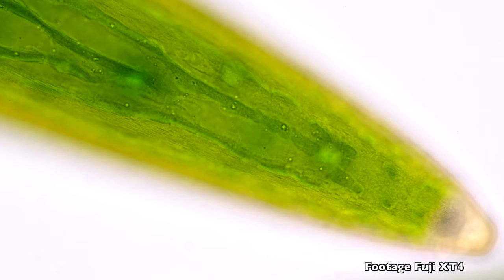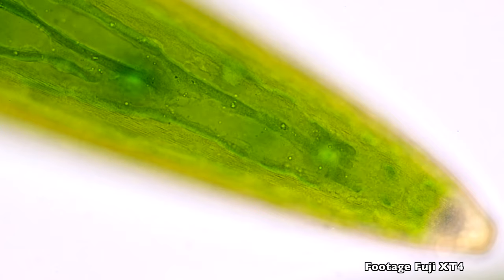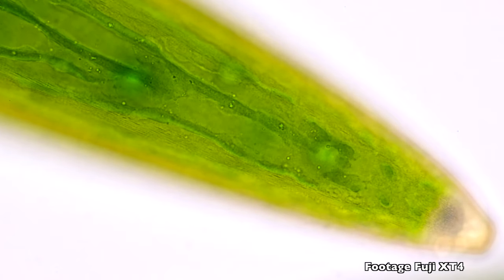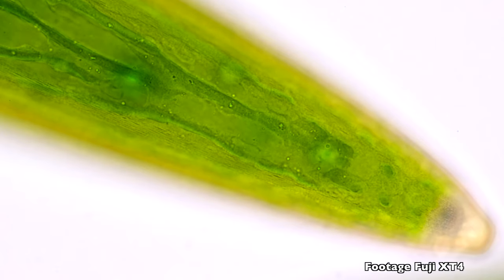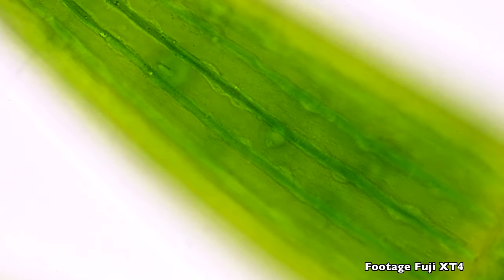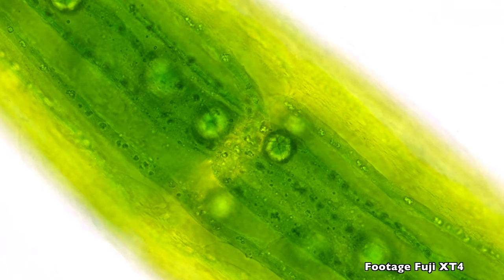I really enjoy making videos with a microscope, so I constantly try to improve the picture quality. And very recently, I got my hands on a Fuji XT4 camera, which came out very recently. The reason why I got interested in this camera is its predecessor, the Fuji XT3, which has a very modern processor and delivers a very high level of detail. So I was very curious to use the Fuji camera on a microscope. Especially the colors, I heard, are very good.